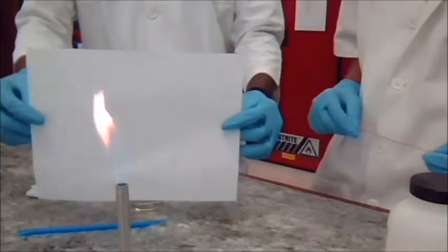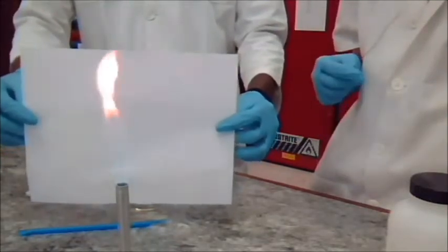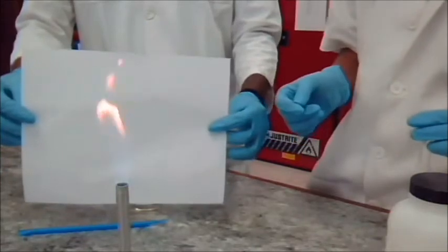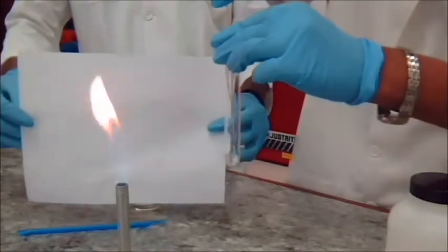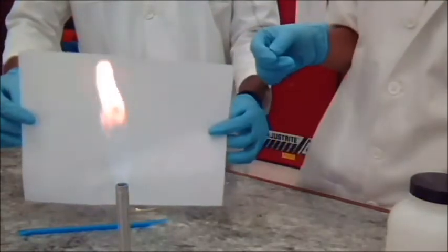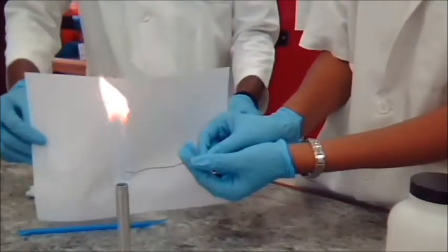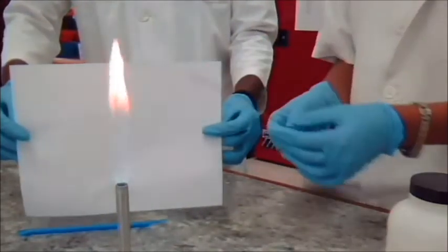We're now going to do the Beilstein test for halides. We're going to use two known compounds, bromobenzene and benzoic acid. First, we're going to take a copper wire and heat it in the Bunsen burner flame. After cooling, we're going to dip the wire directly into a sample of the unknown. Following, we're going to heat the wire in the Bunsen burner flame again at the lower outside part of the flame. Record your observations.